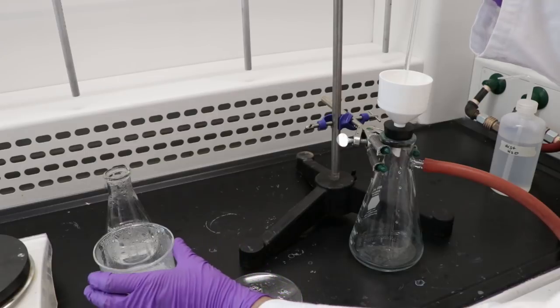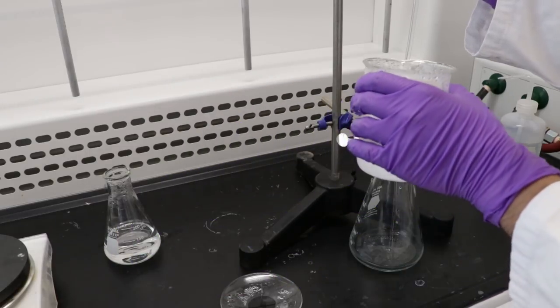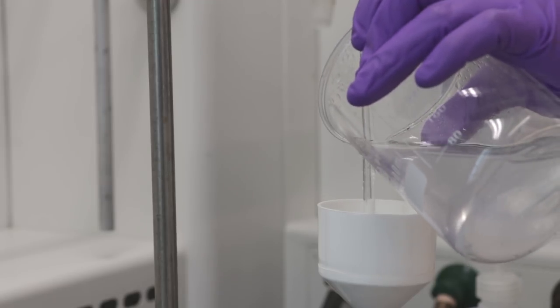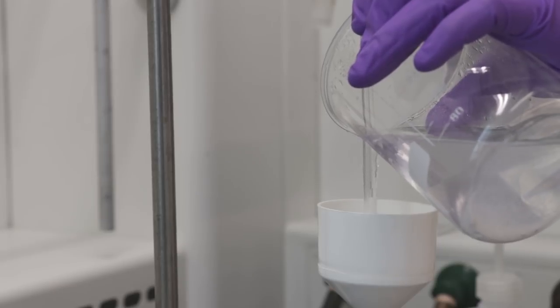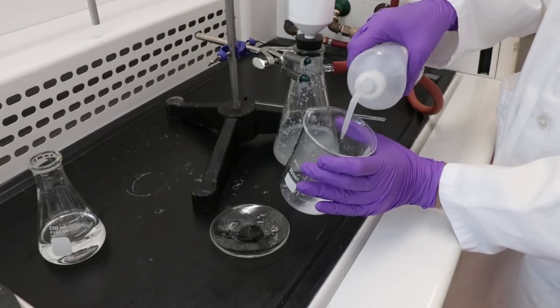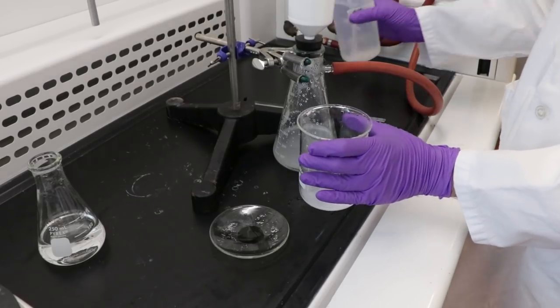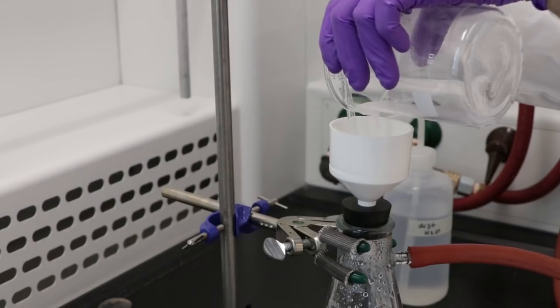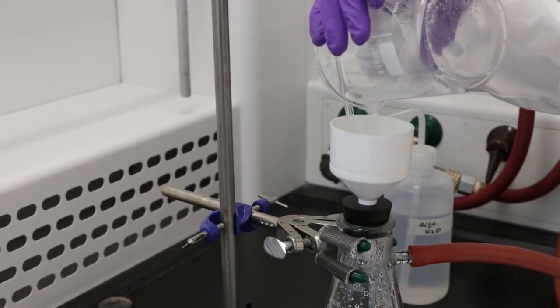Pour the solution into the funnel along a stir rod to collect all the precipitate. Rinse the beaker and the stir rod with distilled water to obtain the remaining precipitate.